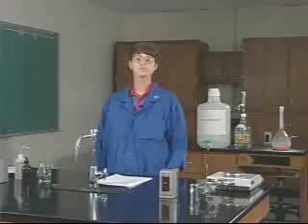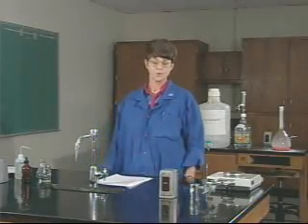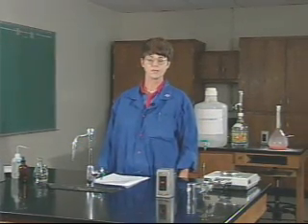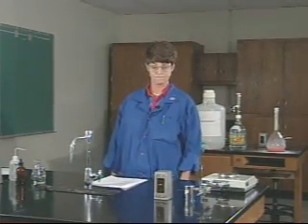In this experiment, your unknown is going to be vinegar, and you're going to be trying to determine the amount of acid that's in that vinegar sample.